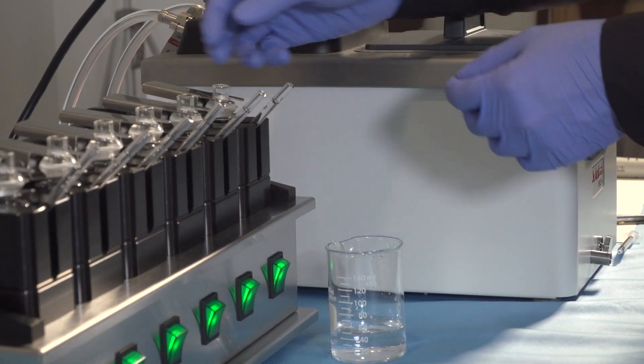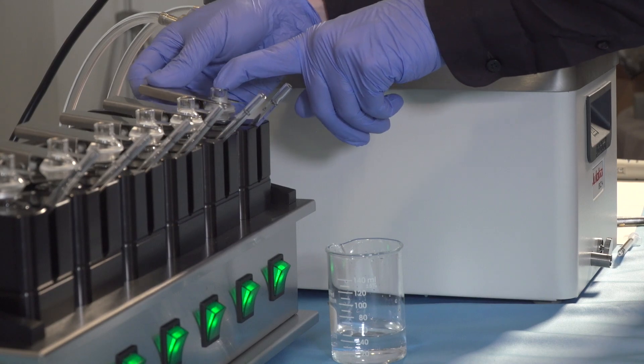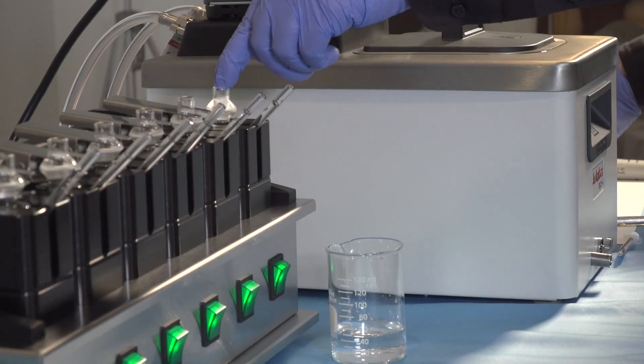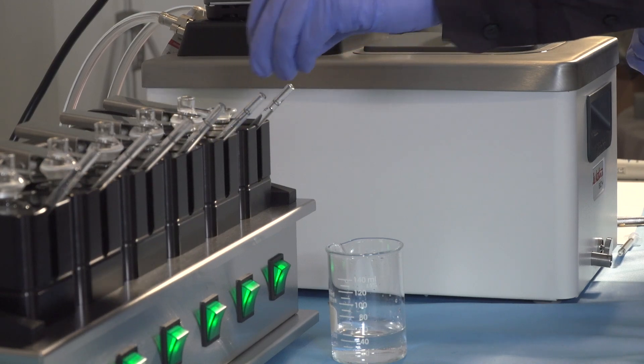Cleanup should occur after any processing of the donor chamber for mass balance. Once the donor chamber is processed, remove the clamp and lift off the donor chamber. Remove it and the membrane for any further processing.